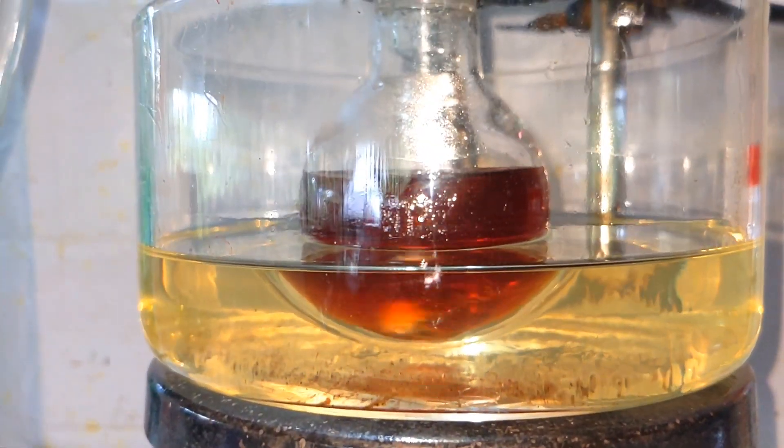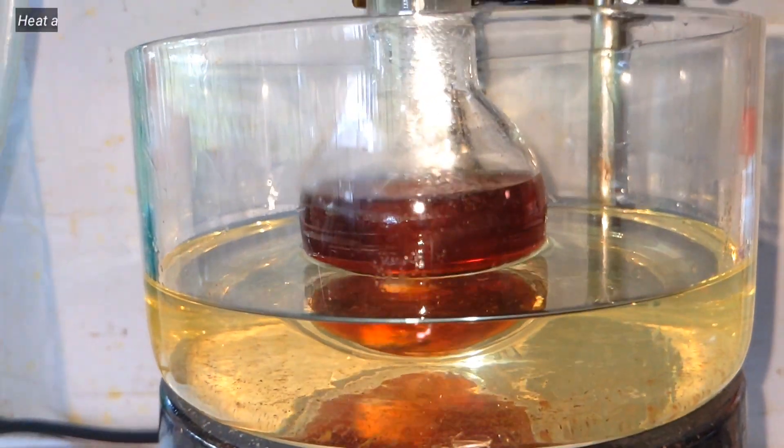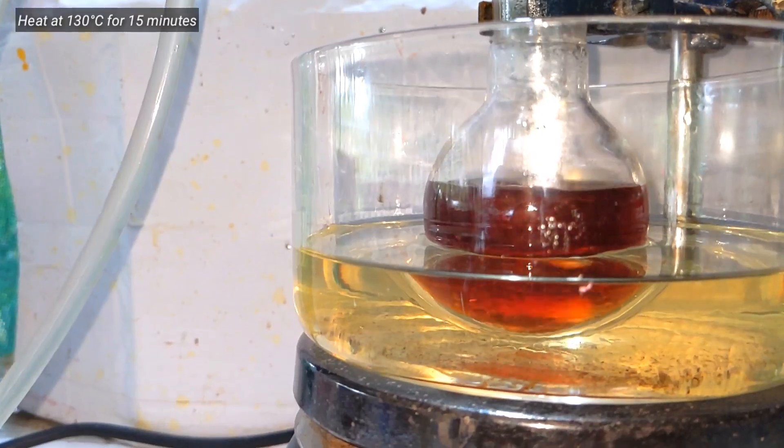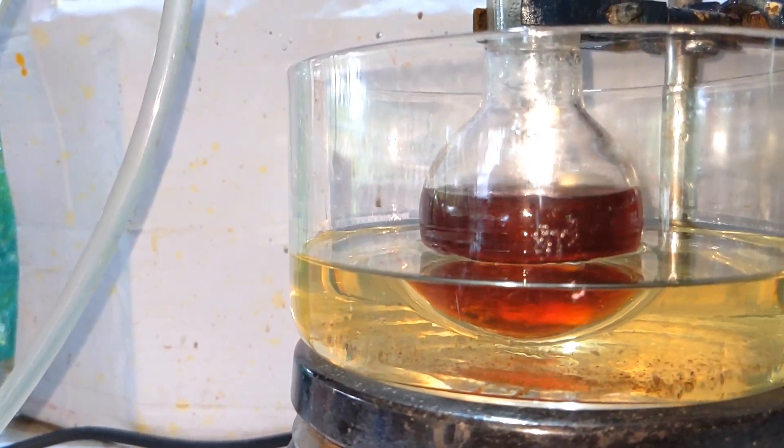After 2 hours the temperature was elevated to 130 degrees Celsius and refluxed for another 15 minutes. This will ensure the complete carboxylation.